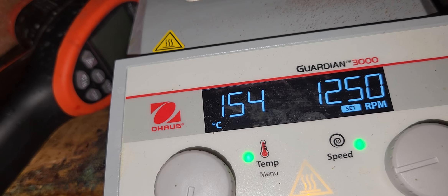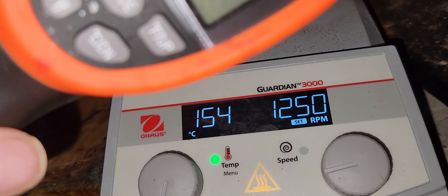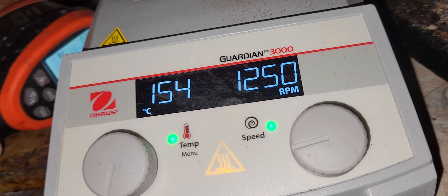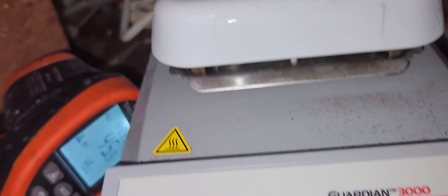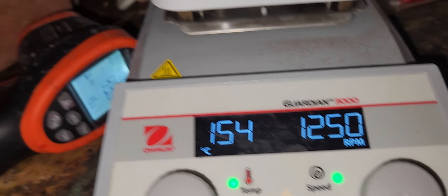You could use a digital thermometer like this. Right now it's 45 degrees Celsius — I'm waiting to get it to about 60–70 degrees Celsius and continue to boil. As you can see there's steam on the surface. I'm waiting for the leaves to fall in, but you could do it without that.